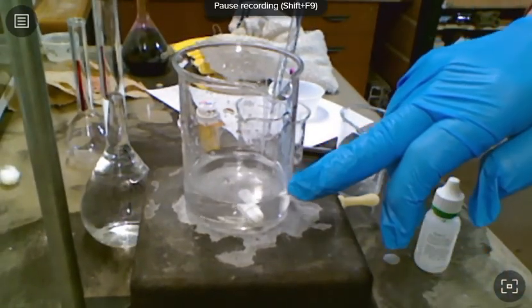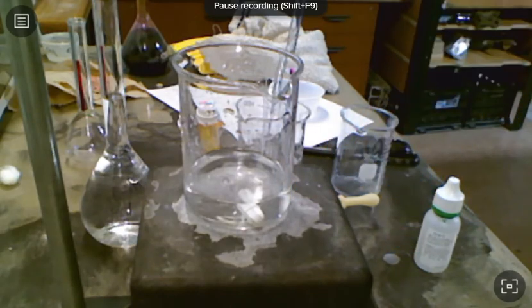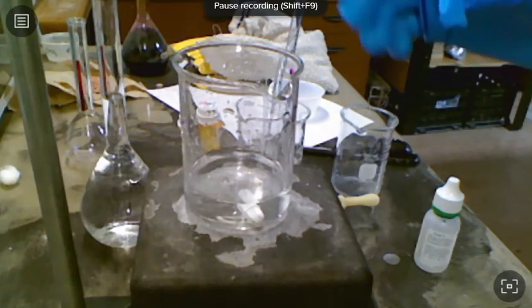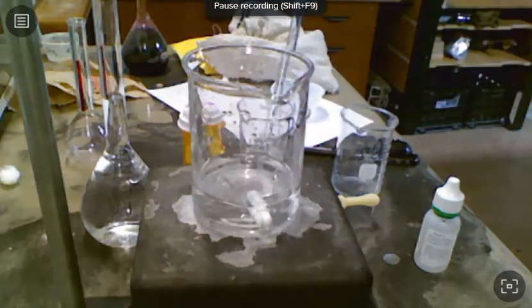So what I would do now is this again, and I would put a fresh 5 mils in there, and I would then titrate it, and I would add 18 milliliters, watching it really closely. Then when I get to that, I would slow it down and add it drop by drop so that I can dial in far more precisely. But roughly, this took 19 milliliters of 1 molar hydrochloric acid to titrate that solution.